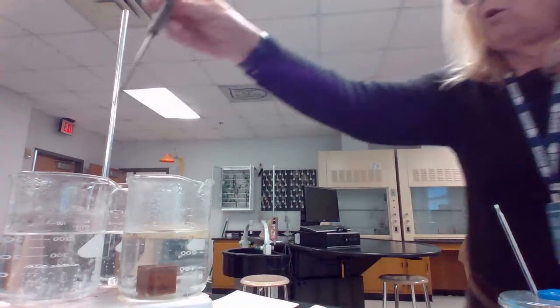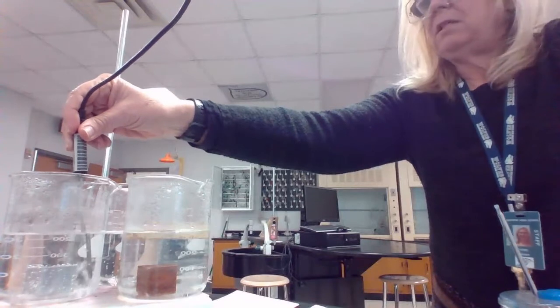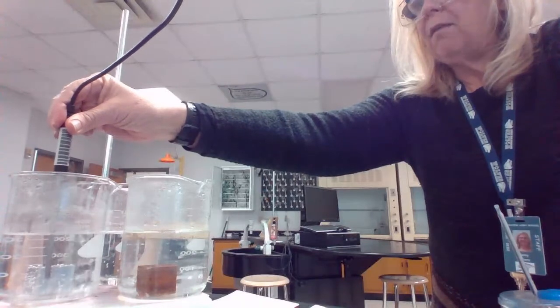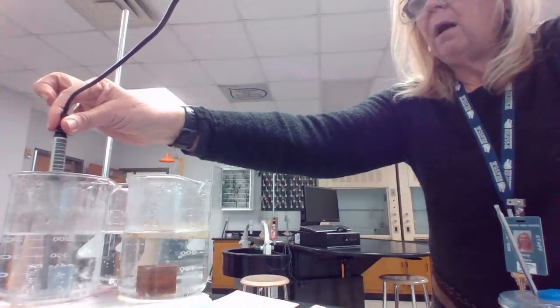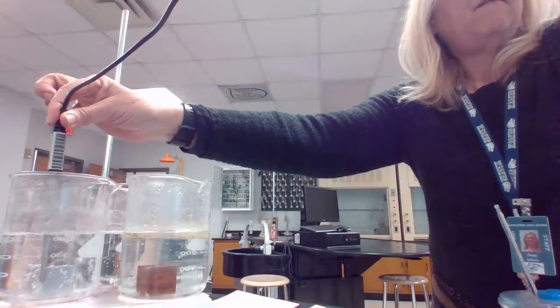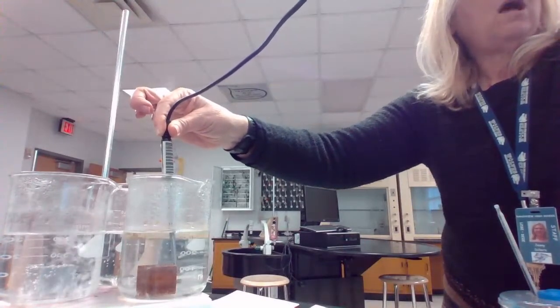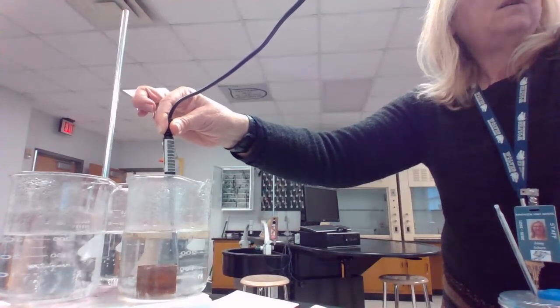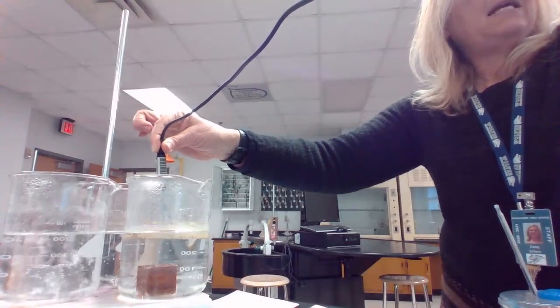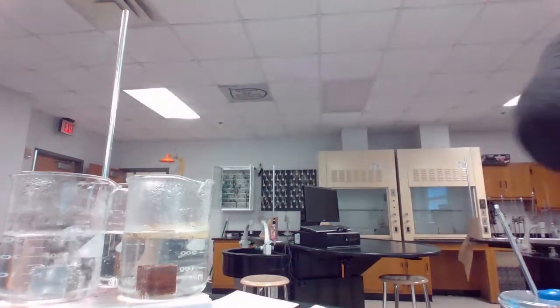So here is my temperature probe, and the aluminum is going up super fast. Notice I'm holding it up. I am not letting it rest on the bottom, because resting on the bottom or touching the aluminum would give me a different temperature. So right now I have about 96, 97.2 in that one. In this one, I have more like 91, and in this one, also 92-ish. Okay, so I'm going to let those boil for just a little bit.